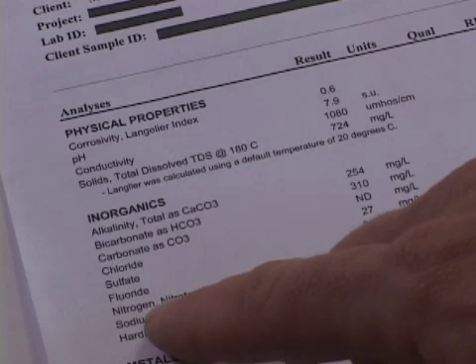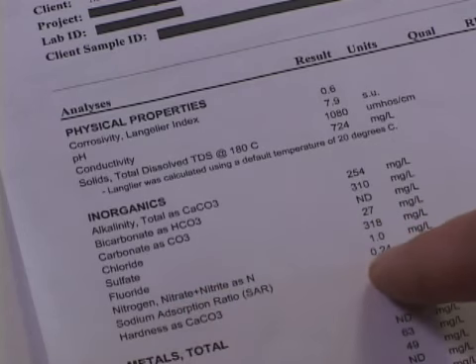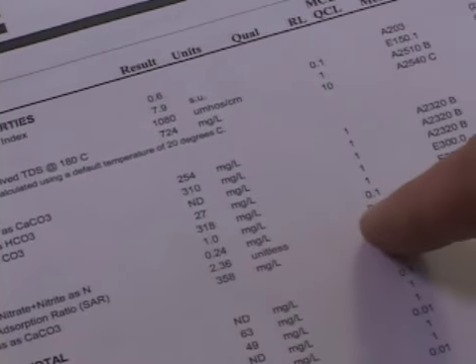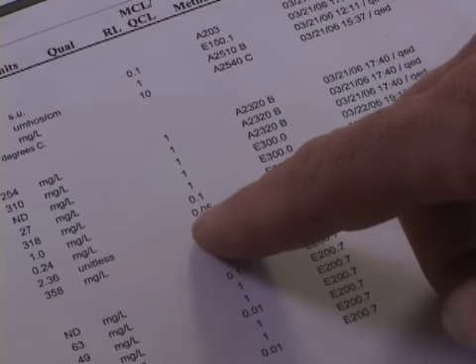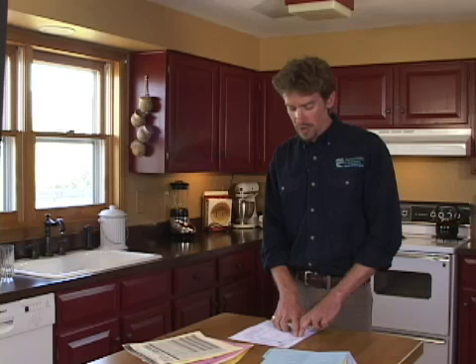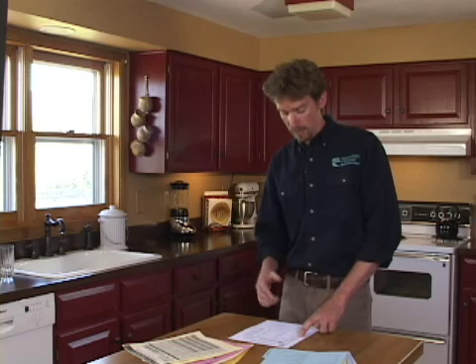And then there's a little bit more information oftentimes about the method, the analysis that was done, who did the analysis, and when it was done. Looking here, for instance, at the result for nitrate nitrogen as nitrogen, the result is 0.24 milligrams per liter with a reporting limit of 0.05. The drinking water standard for nitrate nitrogen as nitrogen is 10 milligrams per liter, so we're far below that. Nitrate nitrogen is a primary drinking water standard because it can cause health problems.